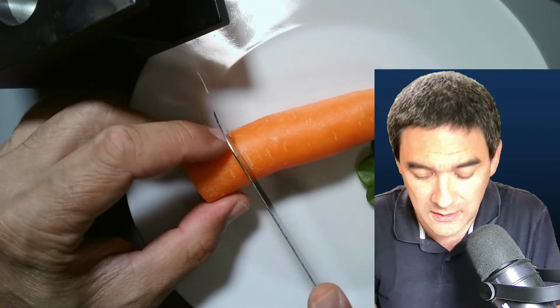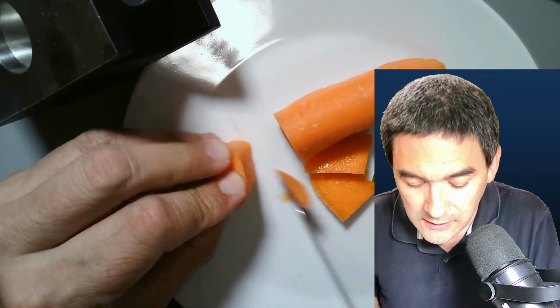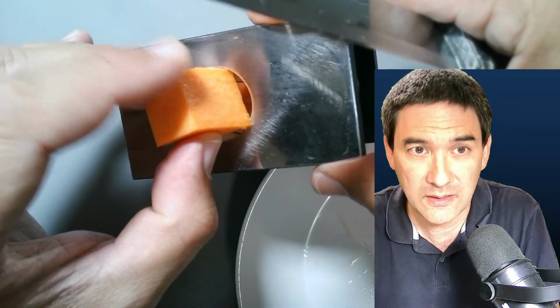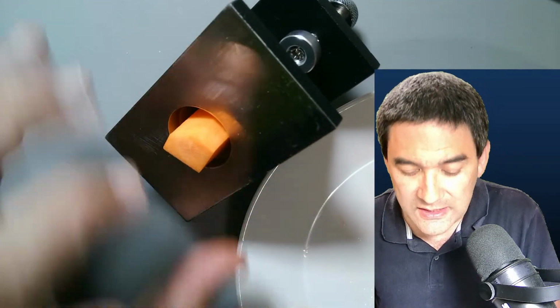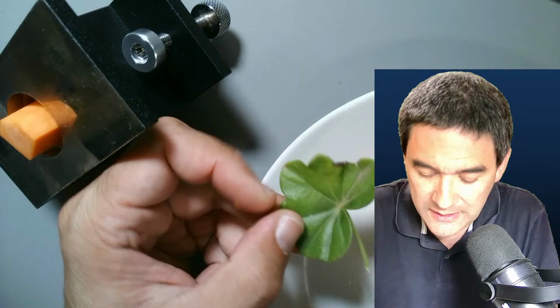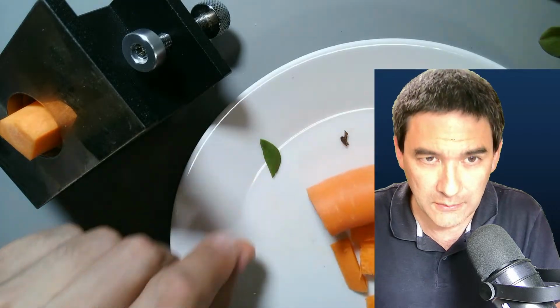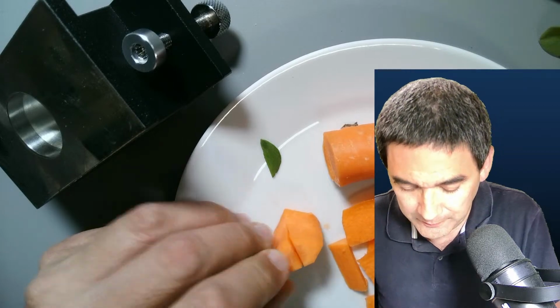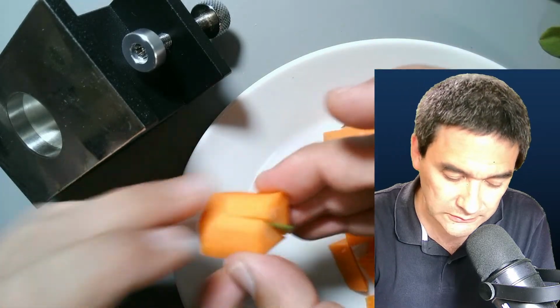Okay, here now you can see it. I'm going to get a piece of carrot, and I'm going to cut the specimen too small. Okay, so let's try this. It's still too big. I'm going to cut it too small, like this, and this will now be our specimen holder. I would like to microtome this leaf over here, so I'm going to cut a piece of the leaf. That's the one I'll be using. Now I'm going to make an incision, a cut into the carrot, and put the leaf in here as a holder. Then I drop it in here.